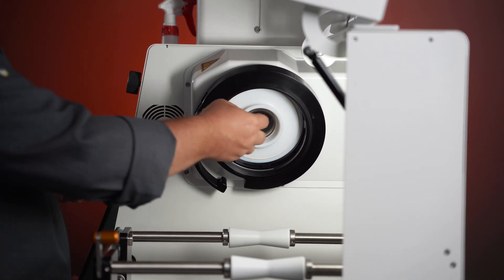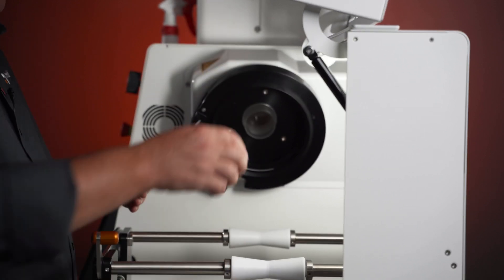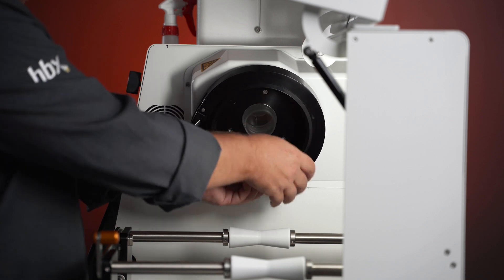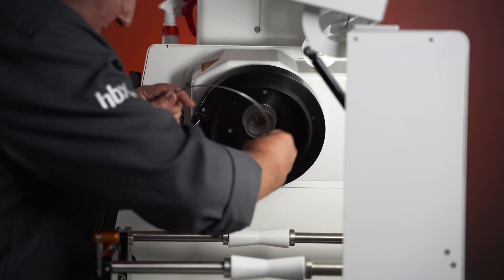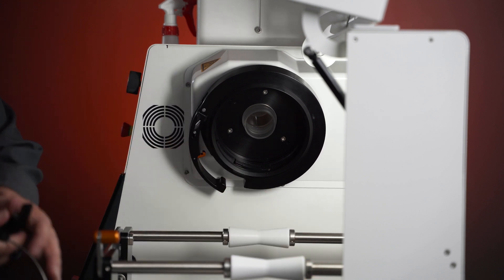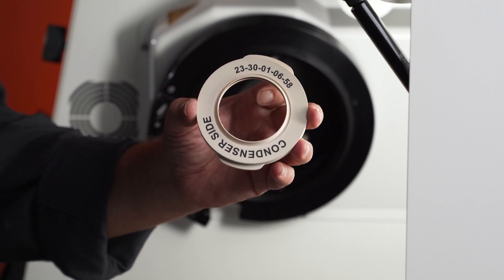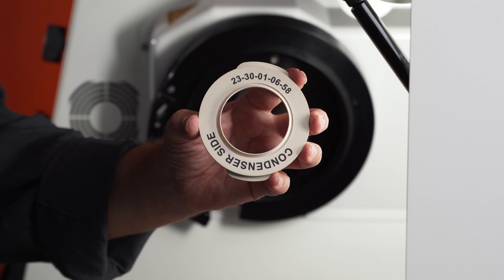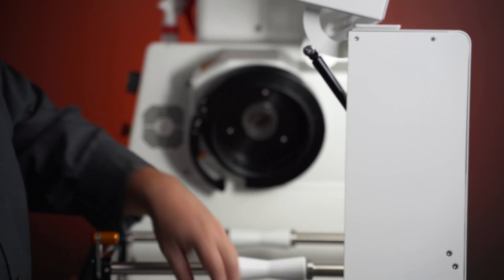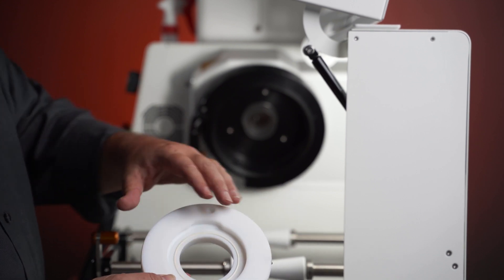For the monthly cleaning, what I would recommend doing is removing your PTFE adapter, your vapor tube seal, your spring, and your guides, and then soaking everything overnight. What this will do is address the grooves inside your vapor tube seal — you don't want any residual components building up inside that seal, as it could start damaging the seal and in turn lead to vacuum leaks. There are also grooves inside the PTFE adapter that require some deep cleaning at least once a month, as that will also lead to vacuum issues if not properly cleaned.